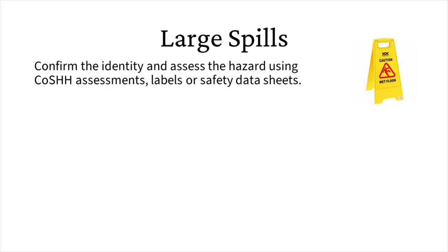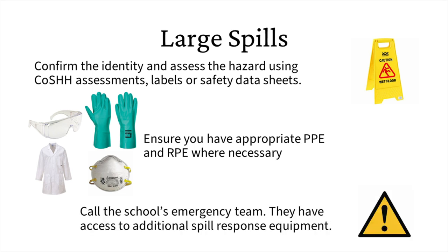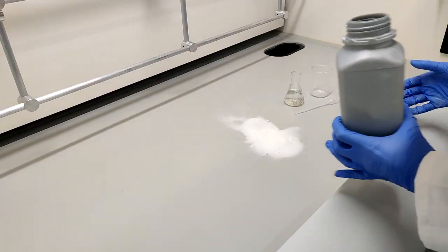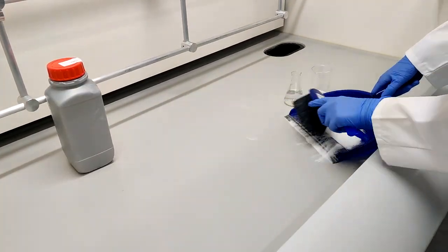You should confirm the identity of the spilled material using the container label, COSH assessment, or any other information so that the hazard can be assessed before beginning cleanup. Those responding to a major spill must have appropriate PPE, including a lab coat, gloves, eye protection, and, where necessary, RPE. The school's emergency team have access to additional spill response equipment, including respirators and disposable overalls. In the event of a large solid spill, the spilled material should be contained and removed using the spill kit's dustpan and brush into a labelled waste container.